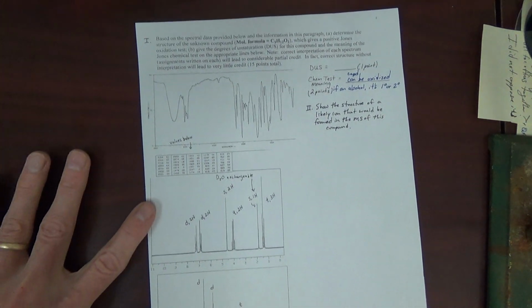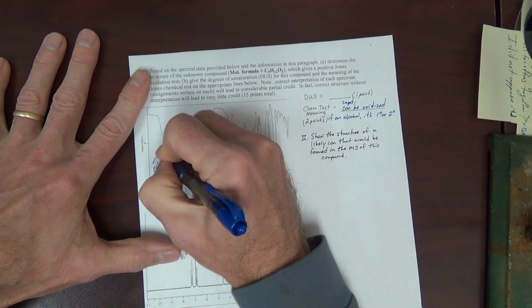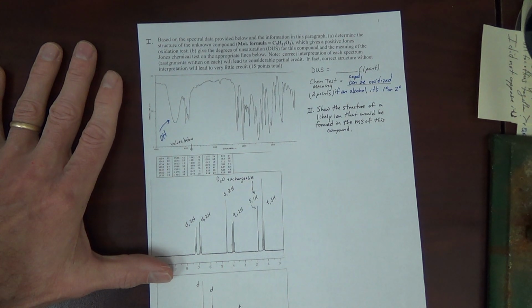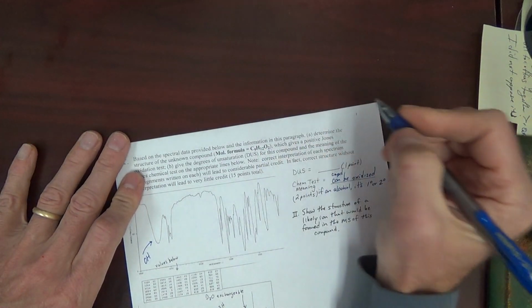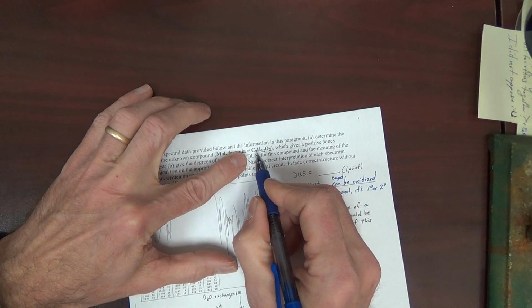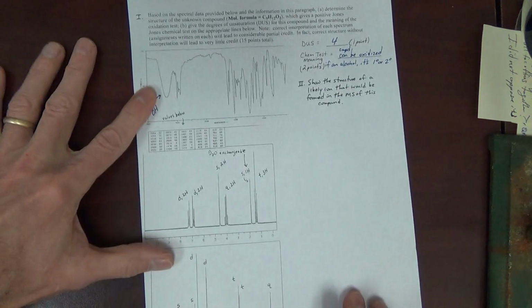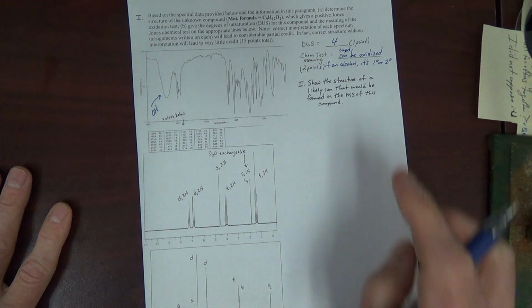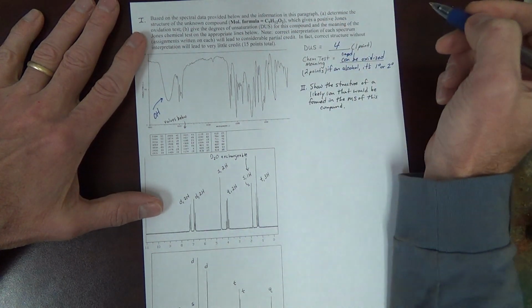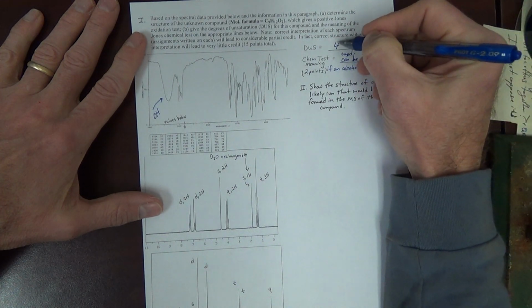Now, is this compound an alcohol? It contains oxygen in the formula? Yes. Look in the IR. Looks like it could be an alcohol. Let's do degrees of unsaturation. C9H12, 2N plus 2 would be 20. We're missing 8, 4 degrees of unsaturation. Useful information. IR. 4 DUs.